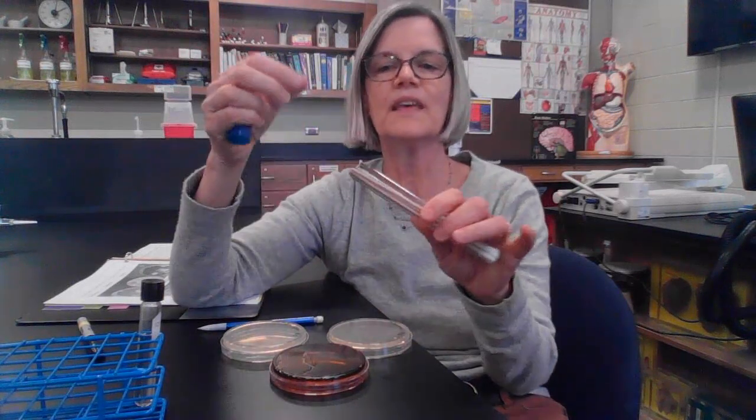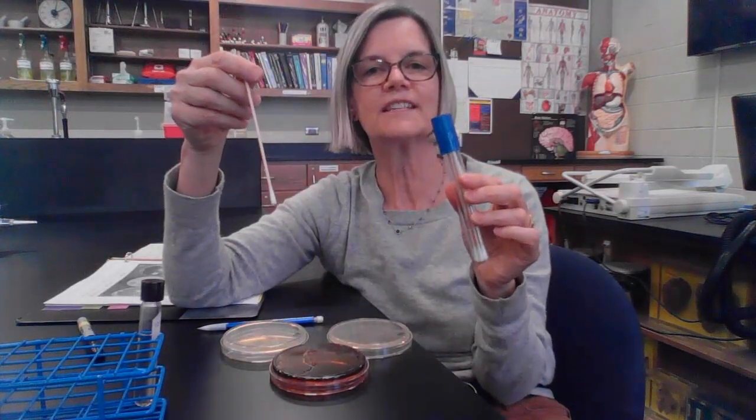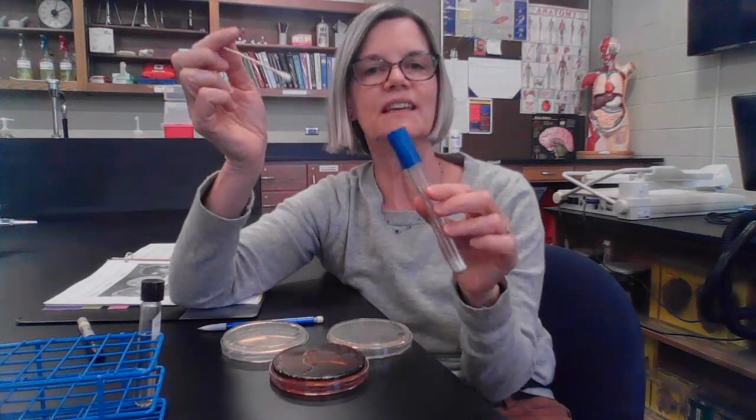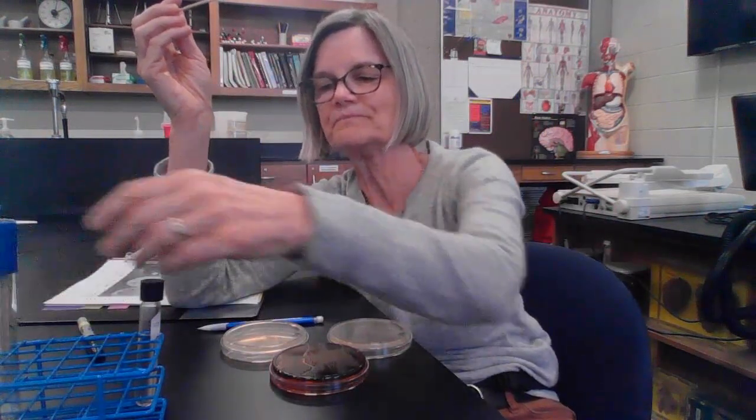We have sterile swabs, and I'm going to open that up and take out one swab, try not to touch the others, and carefully replace the lid. Remember, with things like this, for good aseptic technique, I'm going to open it up and close it as quickly as I can because air goes in there and dust goes in there. We don't want to contaminate those.